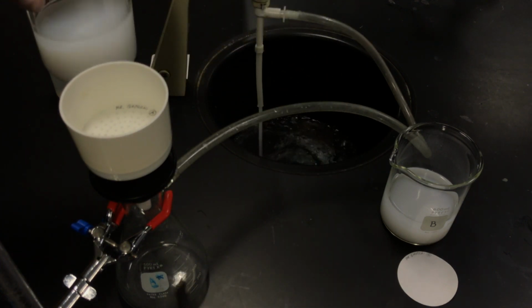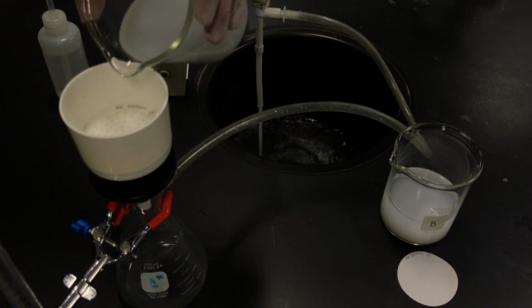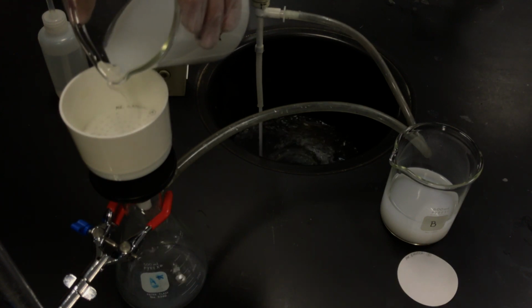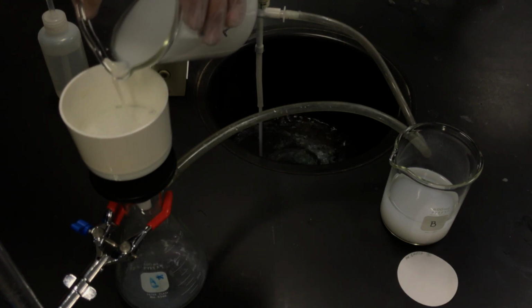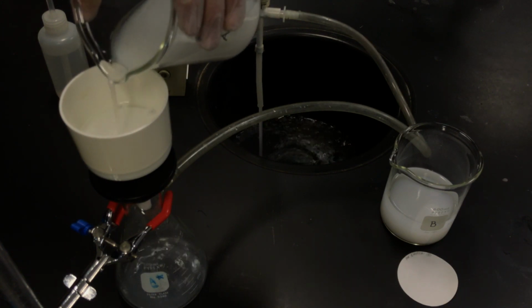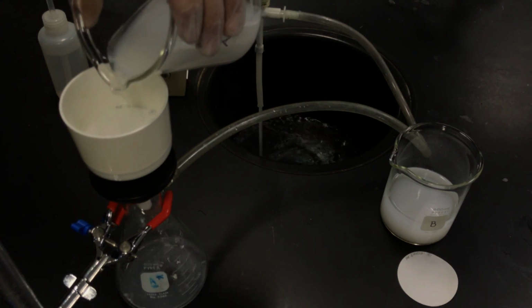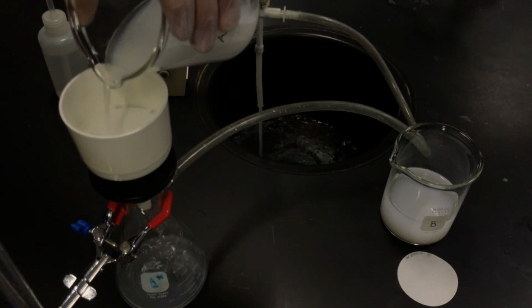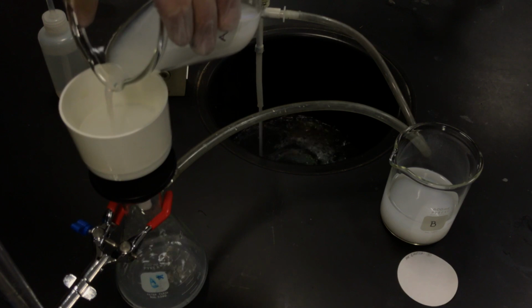I take my rubber policeman and guide any solid precipitates that I see here. Okay, so I'm just going to slowly pour, and we're going to capture our precipitates. Now, the problem with catching or separating our precipitates is that it's almost an impossibility to get all precipitates. We'll do our best here, and if we have to filter a couple of times, we will. And if I look at the filtrate below, it's not absolutely clear, so I will run this once or twice more, understanding I won't get all of them.